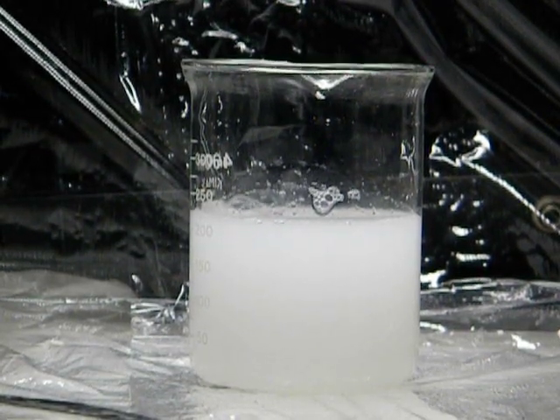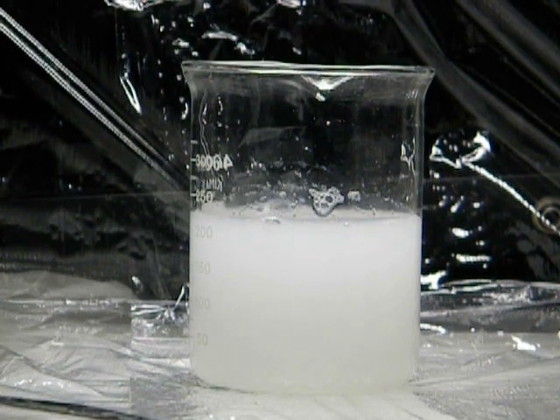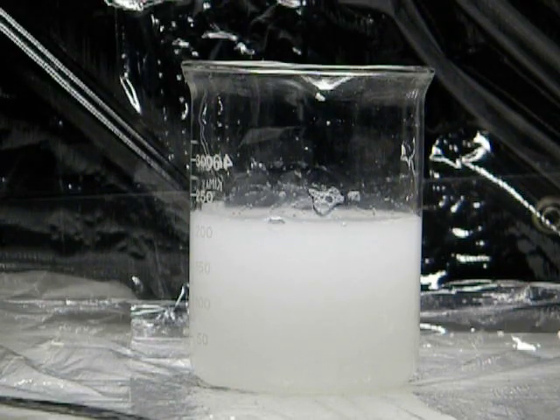It looks like the reaction is mostly finished. I see a little bit of bubbling still going on right here. I see a bubble that's popped there, but that means there's a little bit of calcium down here underneath this. Can I have a guest? Oh, I thought there was a question.